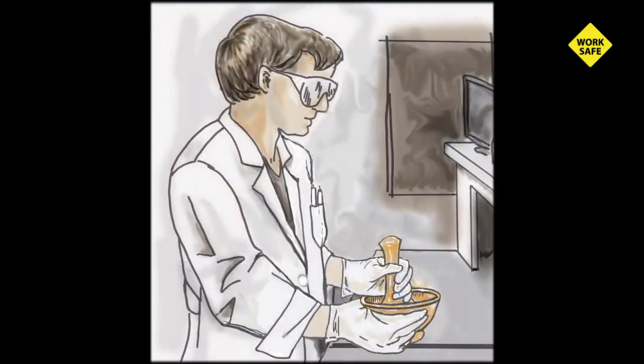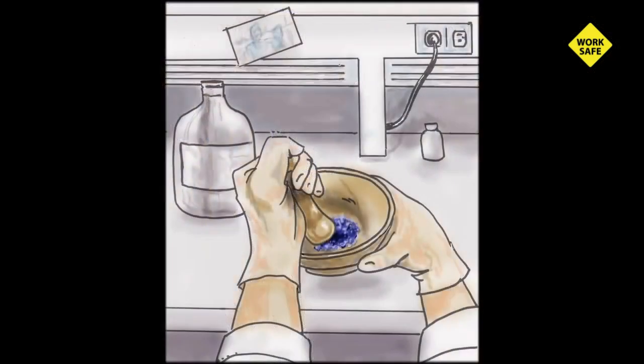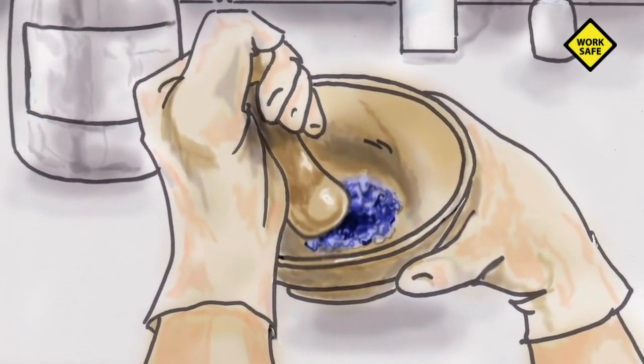After producing the larger batch, the more senior graduate student observed that it contained clumps that he believed needed to be broken up prior to testing. While wearing safety goggles, he transferred half of the new compound into a mortar, covered the compound with a solvent, and used a pestle to gently break up the clumps. After some time, he took his goggles off and walked away.